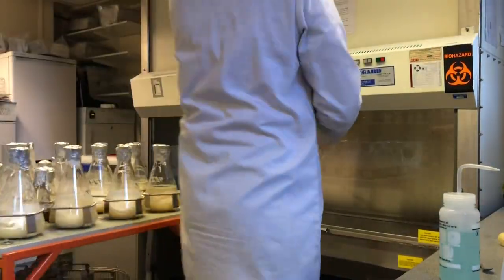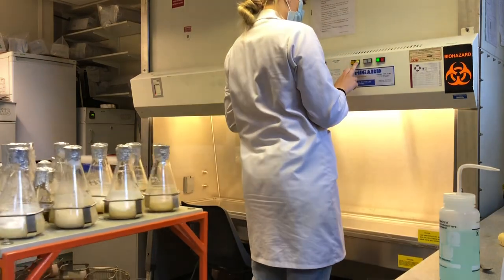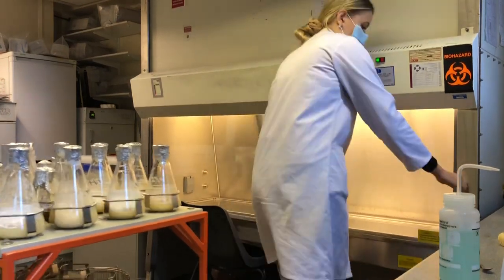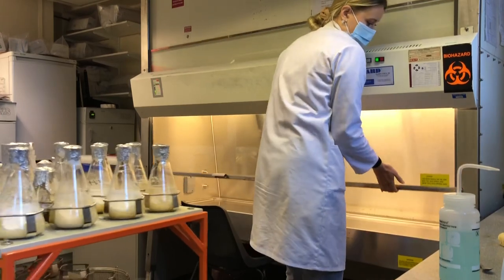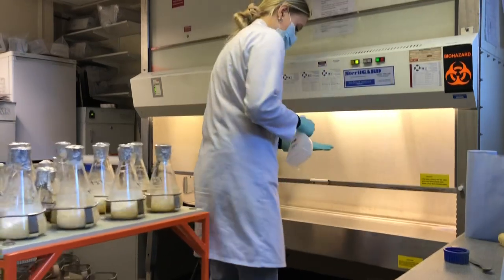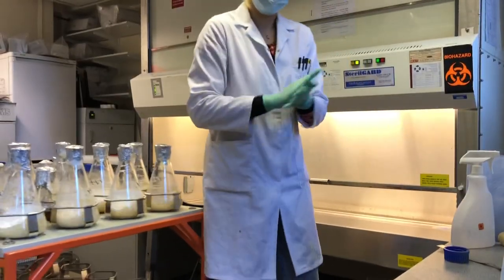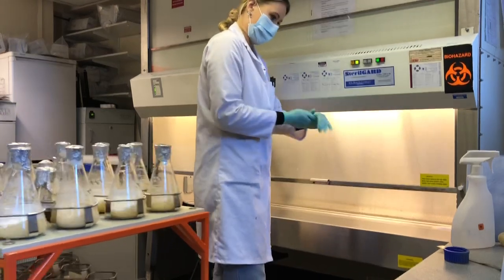One of the most important things whenever you're doing any type of microbiology work is to make sure that you're working in a very clean and sterile environment. This prevents contaminating your bacterial samples. So to do this, we use 70% ethanol typically to decontaminate surfaces and any equipment that we use.